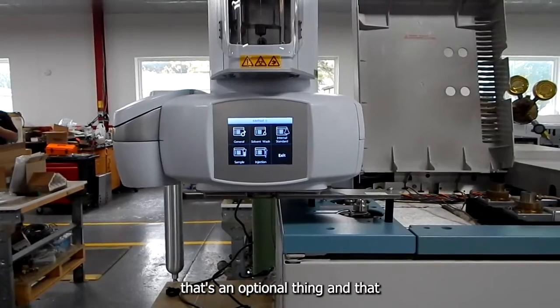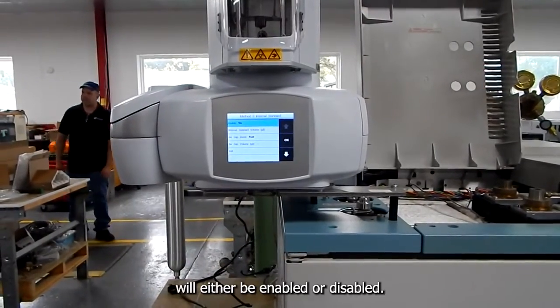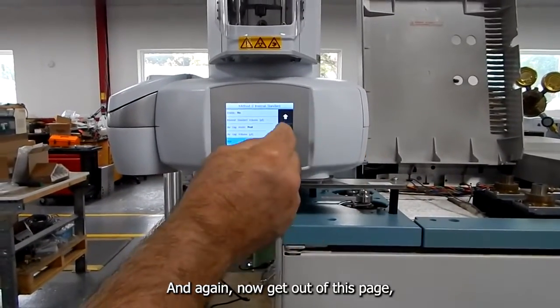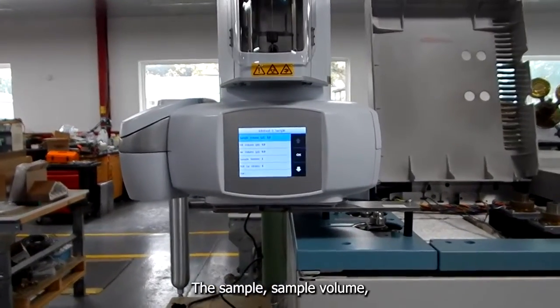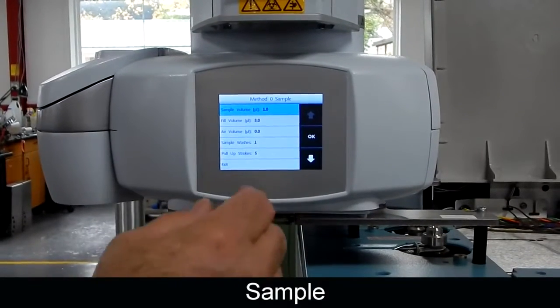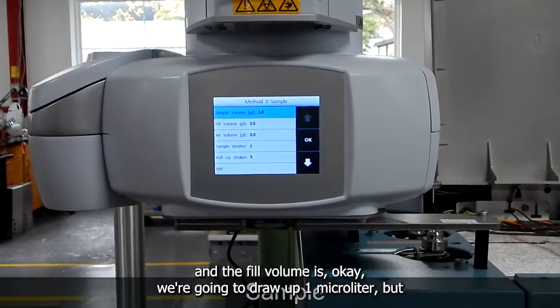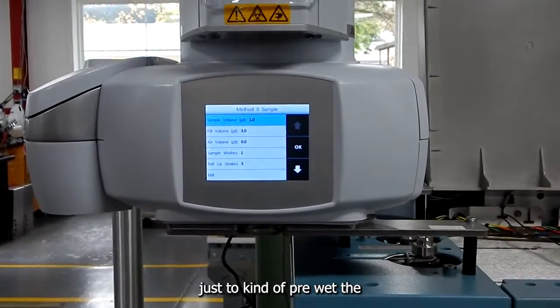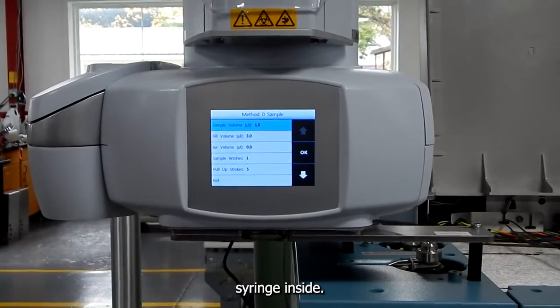Again, that's an optional thing, and that will either be enabled or disabled. And again, now to get out of this page, I've got to go all the way down to exit. The sample volume will be how much sample you want to draw up in there. And the fill volume is, okay, we're going to draw up 1 microliter, but we're going to draw up 3 microliters and come back down to 1 microliter just to pre-wet the syringe inside.